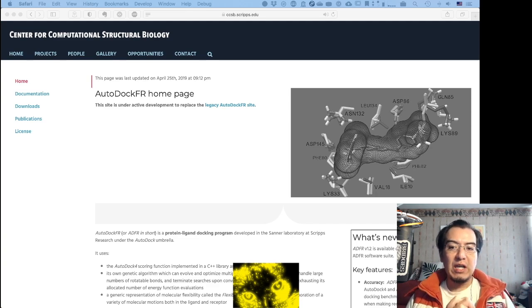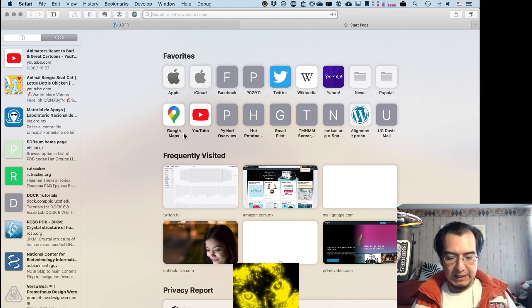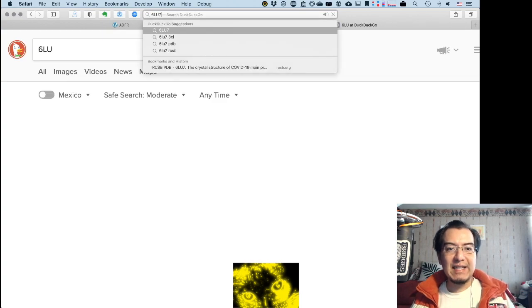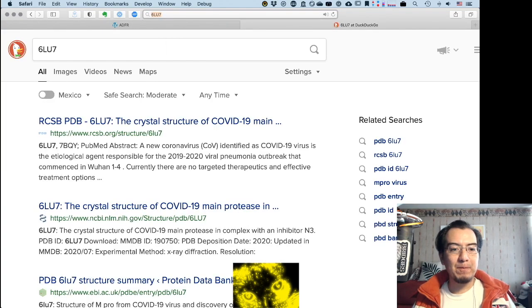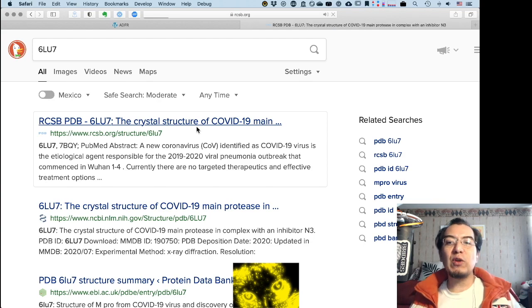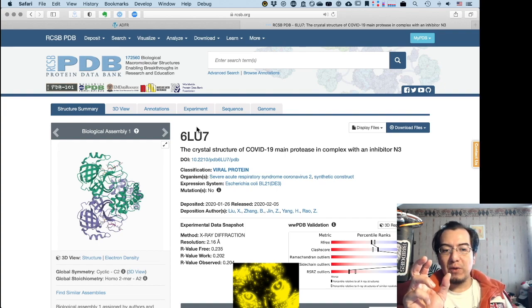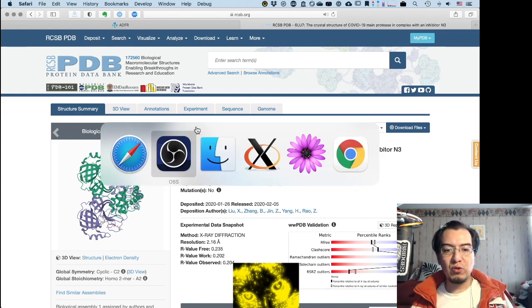And we are going to do this, of course, with the knowledge that we have for COVID-19, specifically with the protease, which is deposited on the RCSB database as 6LU7. This crystal structure, I have already processed using Chimera to separate the protein, the dimer actually, from one of the inhibitors, one copy of the molecular inhibitor already docked here. So I'm not going to show you how to install ADFR or how to prepare these files. I'm only going to show you what to do with them.